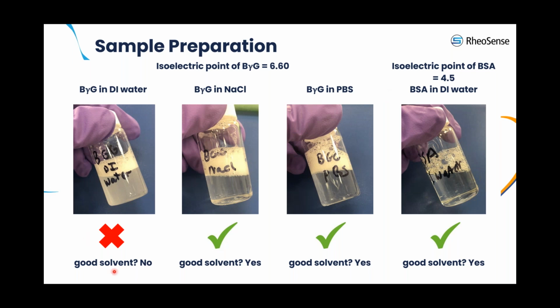If we look at the image of BGG in DI water, we can see clearly a turbidity in the sample. However, BGG is much more soluble in sodium chloride and PBS buffer. On the other hand, BSA is completely soluble in DI water.